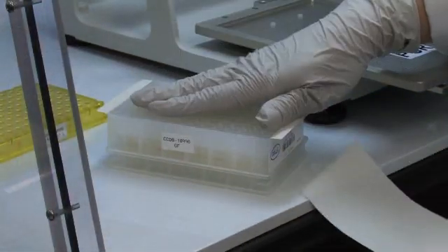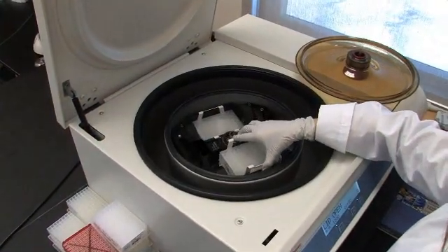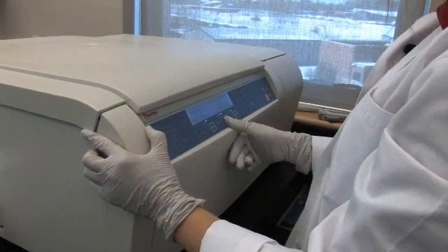After carefully dispensing the sample, the extraction plate is sealed and spun on a centrifuge at 5000 g for five minutes to bind DNA to the membrane.